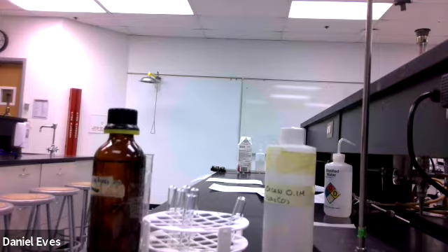What I need you to do for me is pick one of those 4 solutions, whichever one you want, and do the calculation for it, so you can figure out how many grams you would need to weigh out to make a 50 milliliter solution. For the first 3, silver nitrate, sodium carbonate, and copper sulfate, a 0.1 molar solution, and in the cobalt chloride situation, you'd need a 1 molar solution.